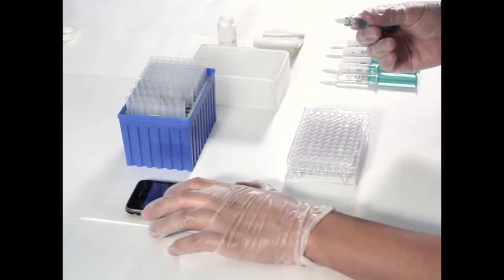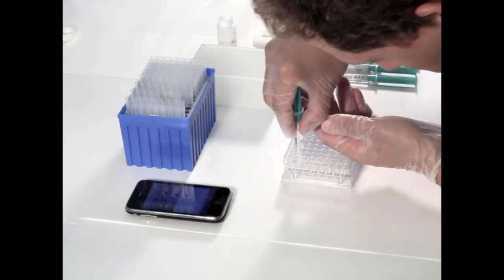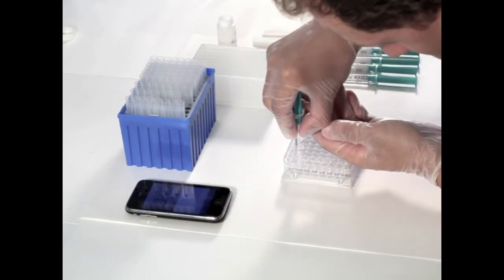The wells of the top plate are then carefully filled with the topical formulations, preferably by using medical syringes.